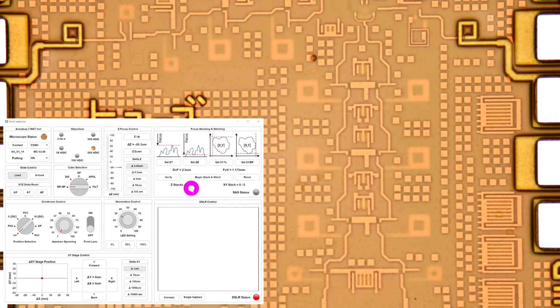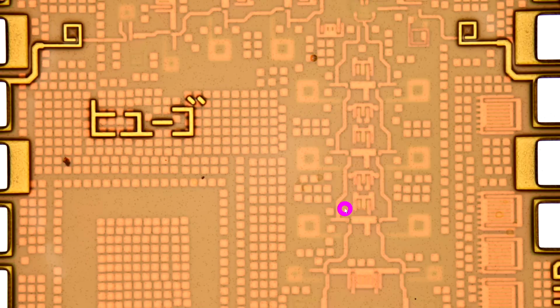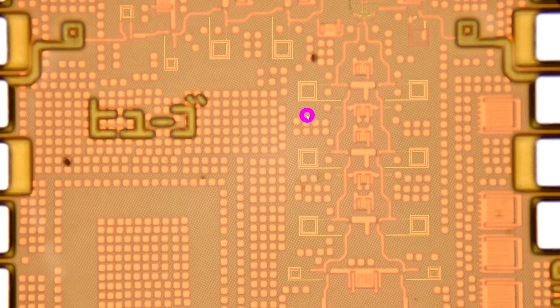So it's 4 times smaller, which means that we're going to need even more stacking of various layers to get a full focus. So we can try it in this example. If you look at the image again, let me minimize that so it's not in the way. Right, so let's focus on the top metal. Looks a nice and sharp focus. The little tiny dots that you see are actually on the surface, a finished surface oxide layer of the die itself. We go further down, and slowly, these metal layers are coming to focus. And if I continue, the lower metal is eventually coming to focus down there.